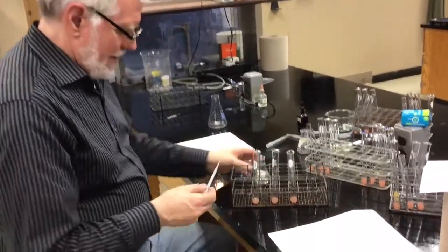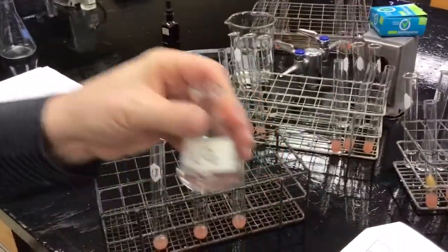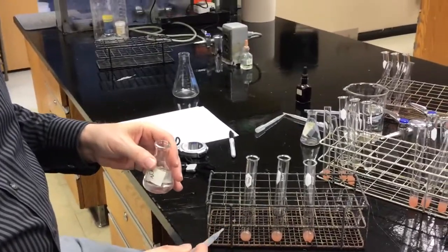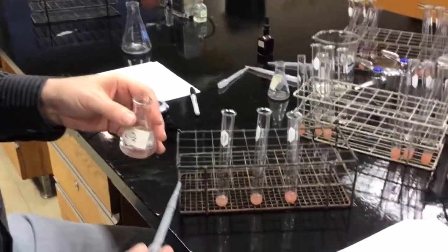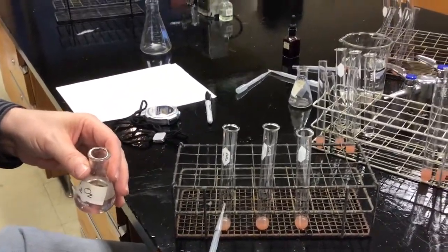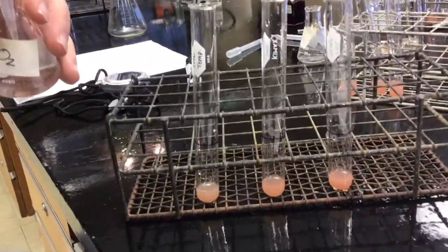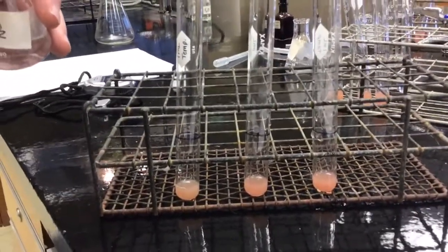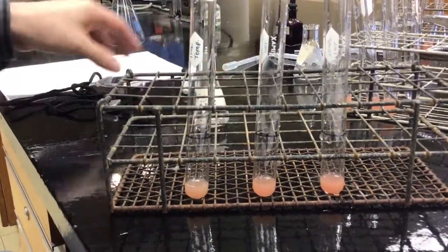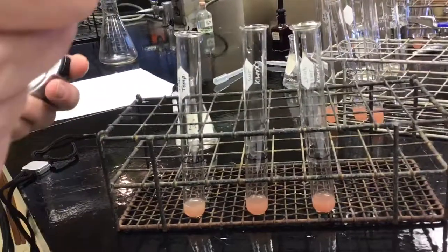is take a milliliter of peroxide, which is our substrate, and squirt it into these things that have been at incubator temperature, and measure the time it takes to reach this line on the test tube. I've got a stopwatch. So we're going to do 3 trials at this temperature.